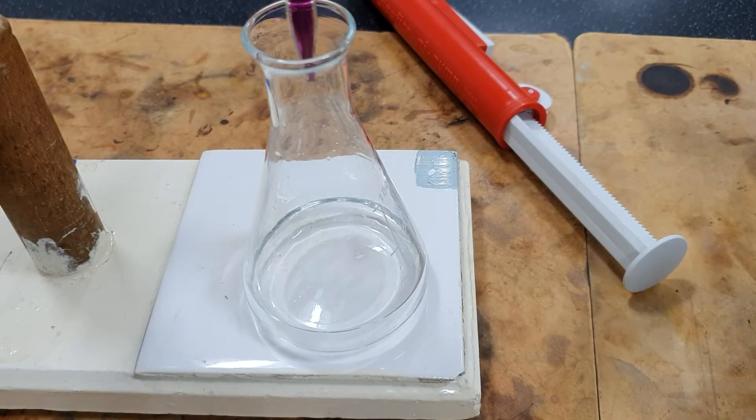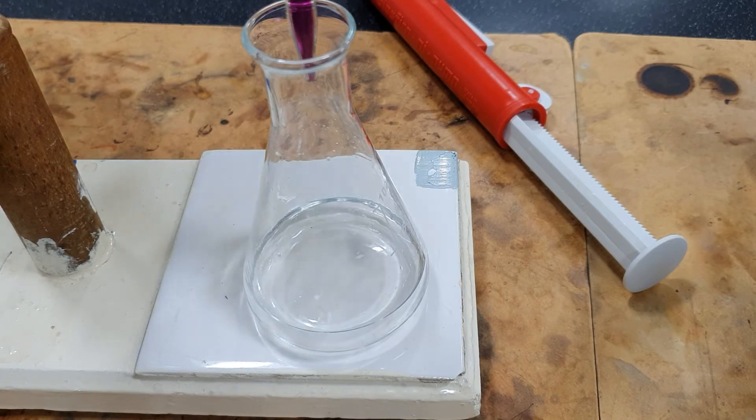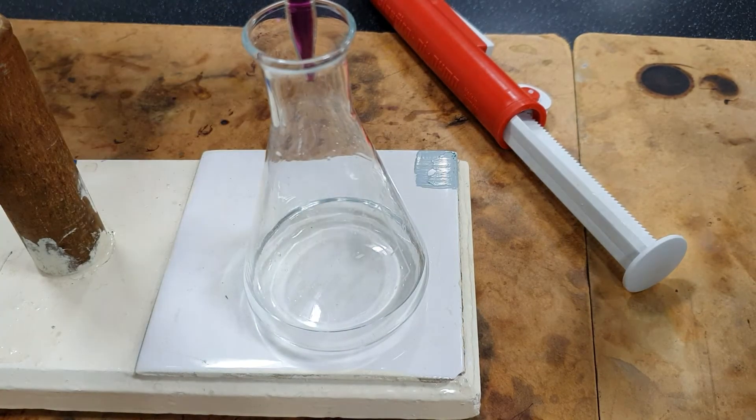Add the potassium manganate until the solution just turns pink.